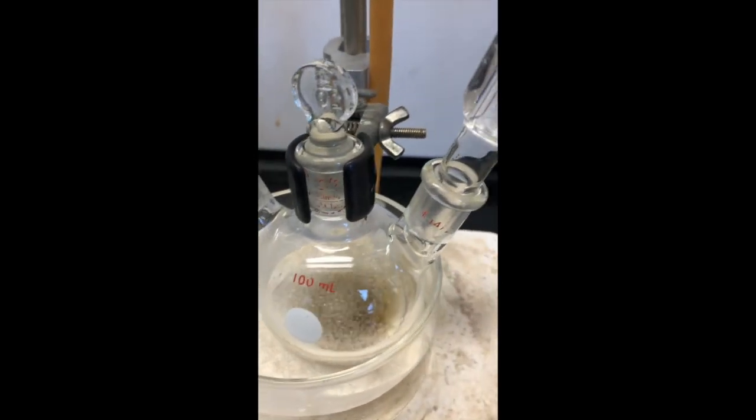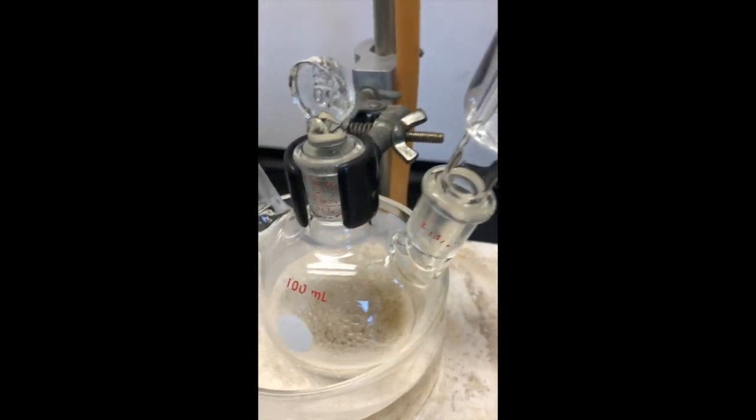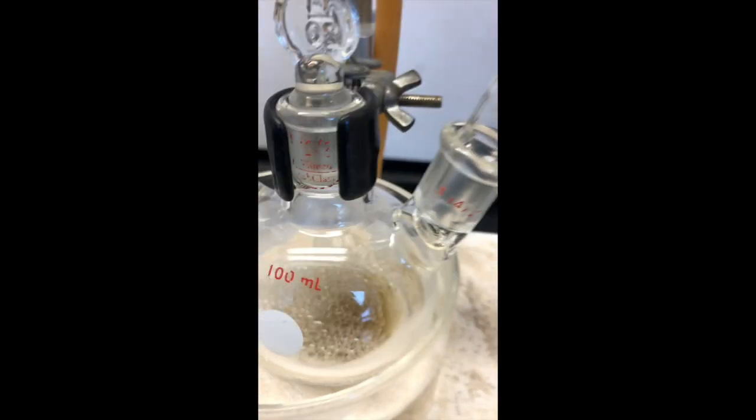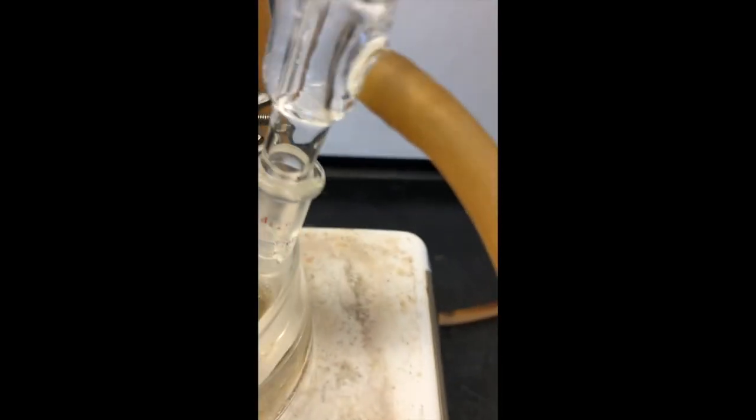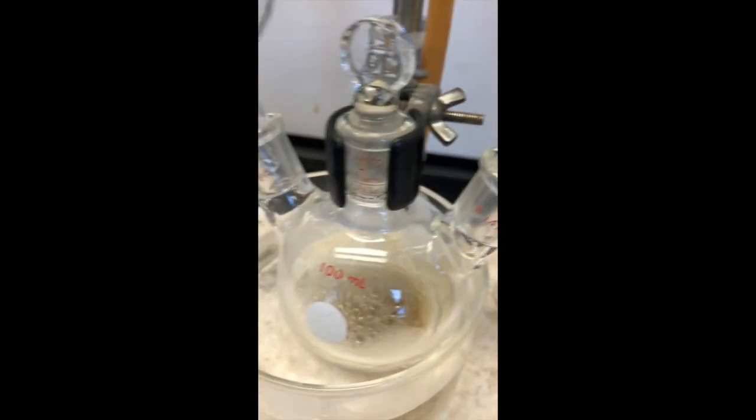Eventually the boiling does slow on its own, but as you get it back to a boil again, the solution then turns quite a bit darker as you can see down there. And we hope that all the magnesium is going away and we're just going to let it finish its 20 minute reflux now.